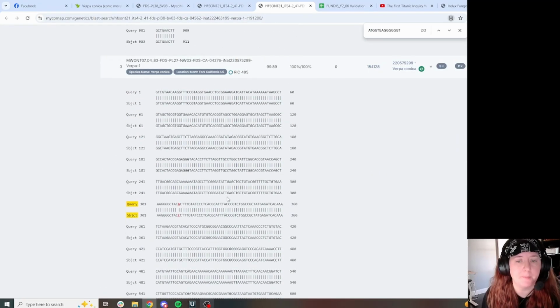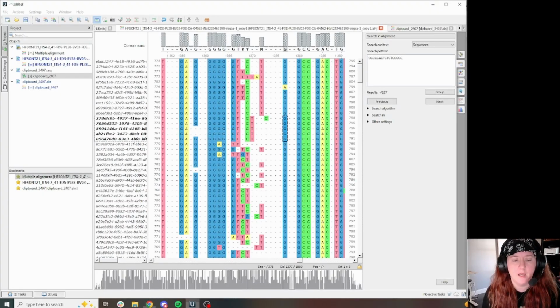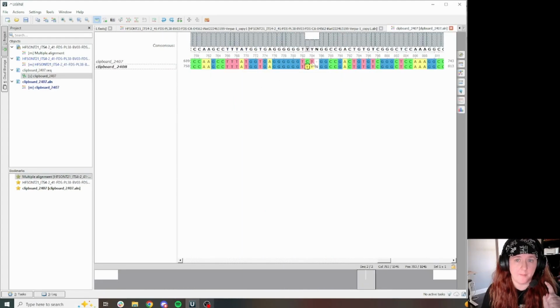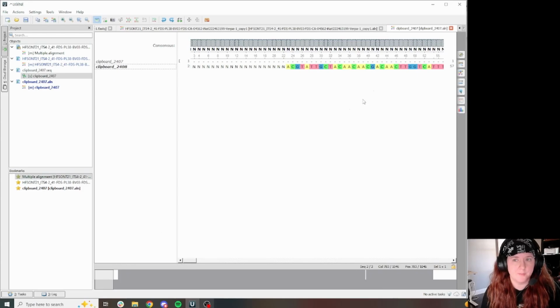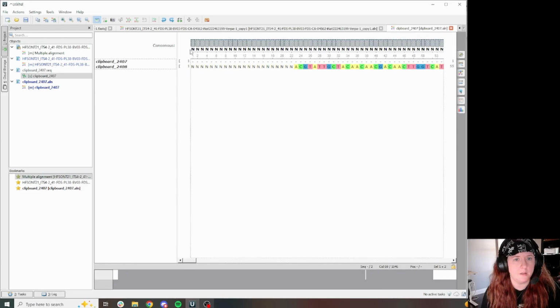So this seems like this might be a spot that could be an ambiguous position that might have an extra T in some haplotypes and does not have that extra T in some haplotypes. But because it's TTCT, it's causing some alignment issues. So this is a case where I'm actually going to not put ambiguities here. So I'm going to trim my ends real quick just so I do it and get it out of the way.